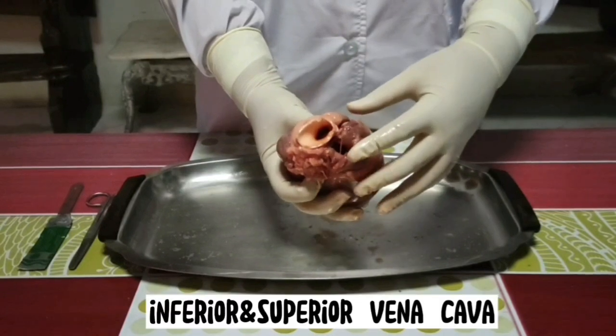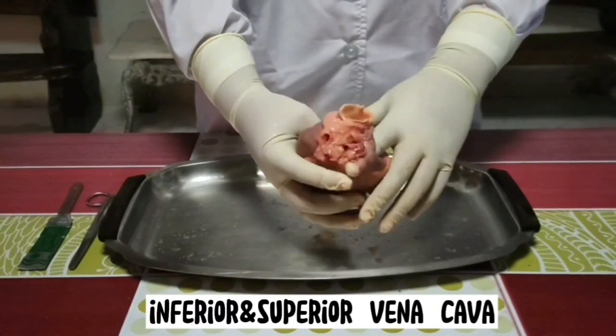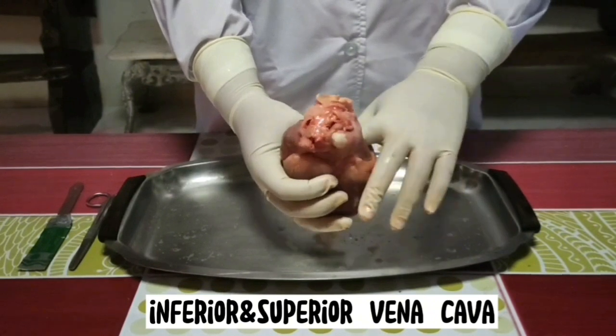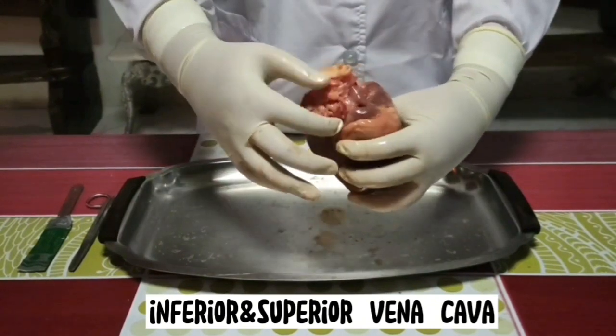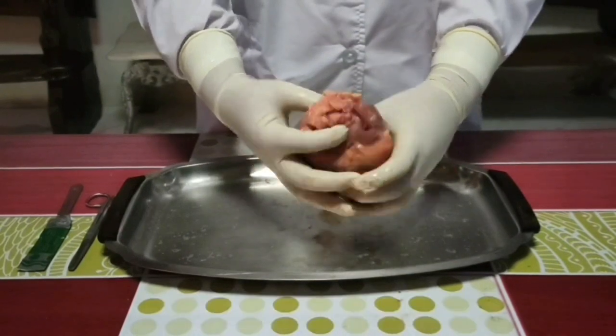Now let's have the inferior and superior vena cava. These two blood vessels are located on your left of the heart and connect to the right atrium. The blood enters the heart through these vessels into the right receiving chamber. Use your probe to feel down into the right atrium. These vessels do not contain valves to control blood flow.